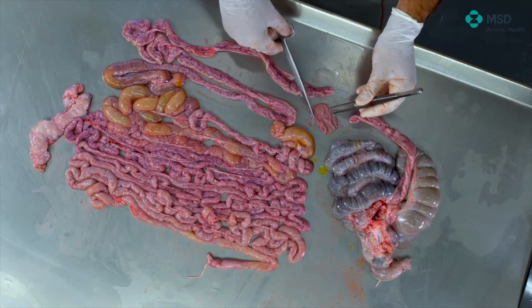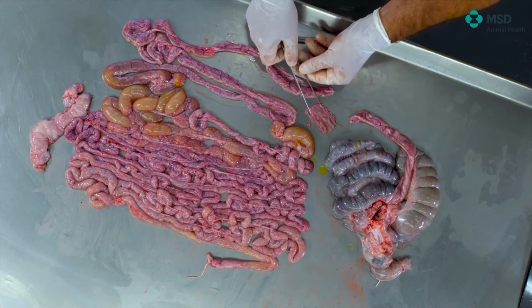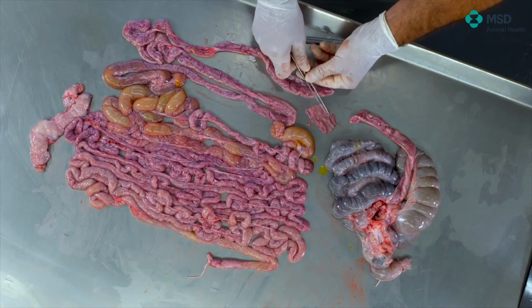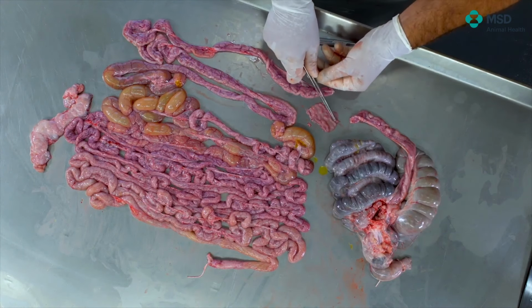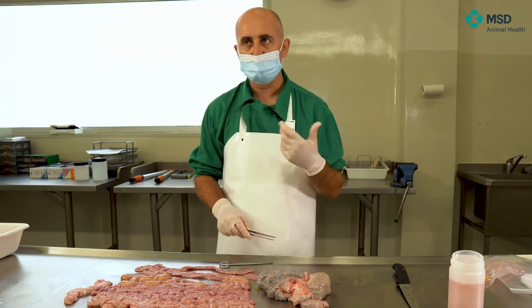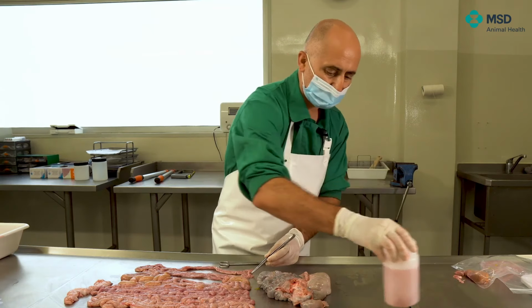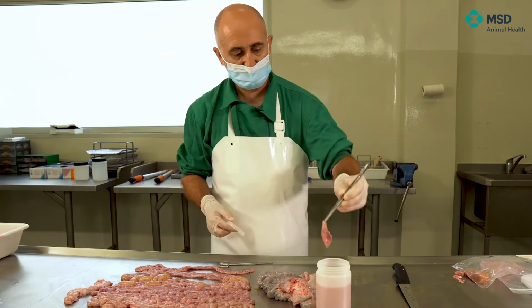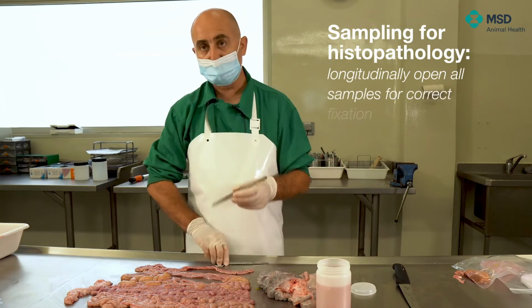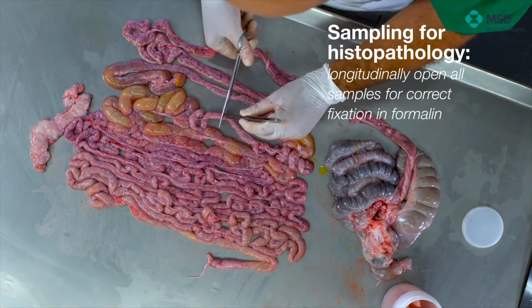And as you can see here, even if it's a very small piece, just the middle part, the part that is signaled here with the forceps, all that part is thicker than the edges that you can see here. This thicker part is the one that refers to the Peyer's patch. So this is an excellent sample that we can use for fixing in formalin. This is for the part of the ileum. We can take even more parts from the ileum if needed.